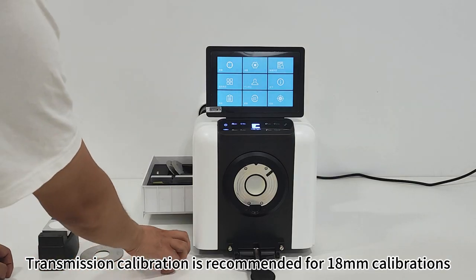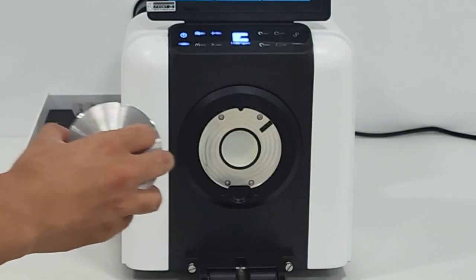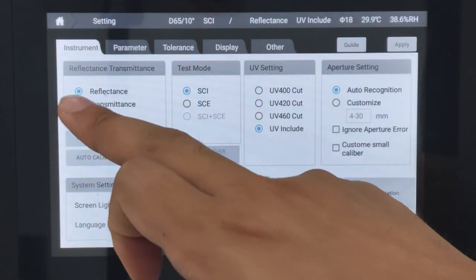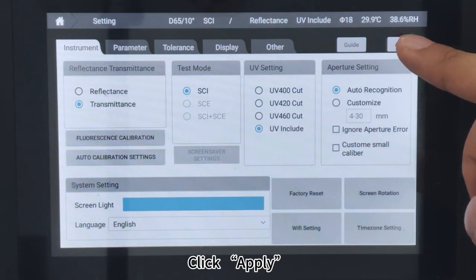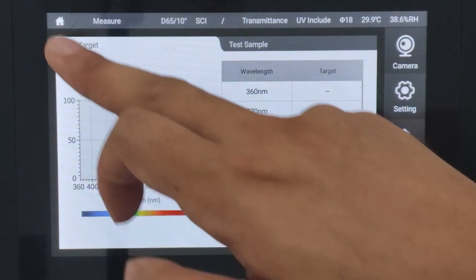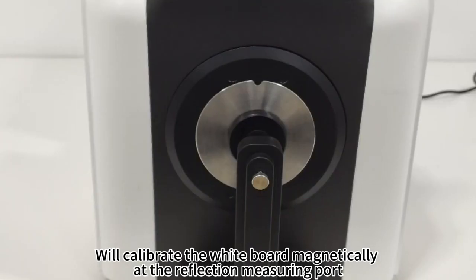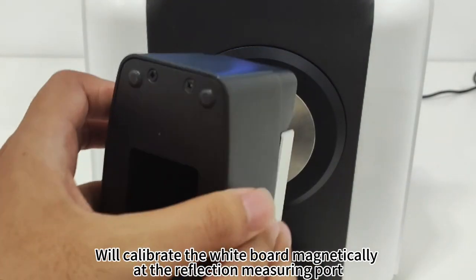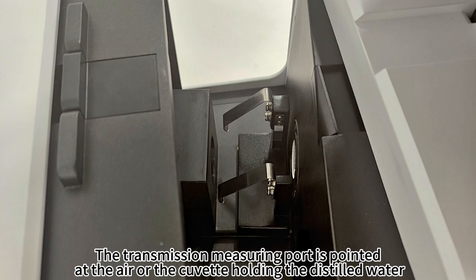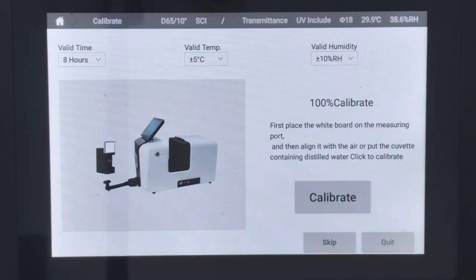Instrument calibration in Transmission mode. Transmission calibration is recommended for 18mm calibrations. Click Set, then click Transmission, then click Apply. Click Calibrate. We will calibrate the white board magnetically at the reflection measuring port. The transmission measuring port is pointed at the air or the cuvette holding distilled water. Click Calibrate.